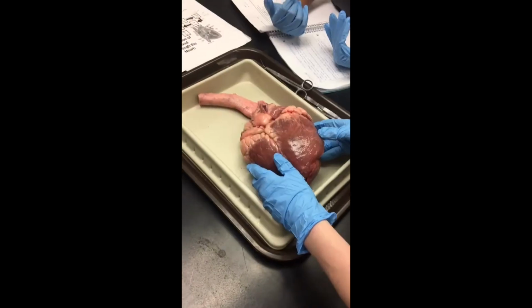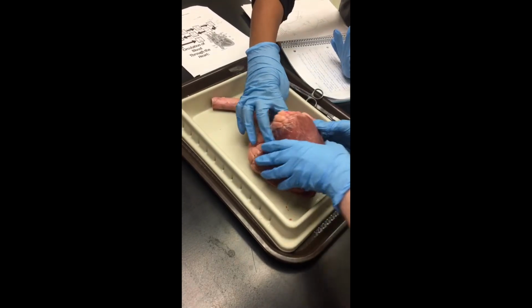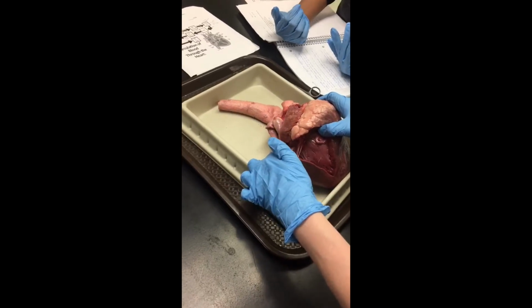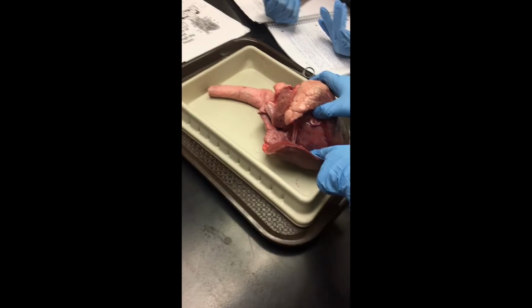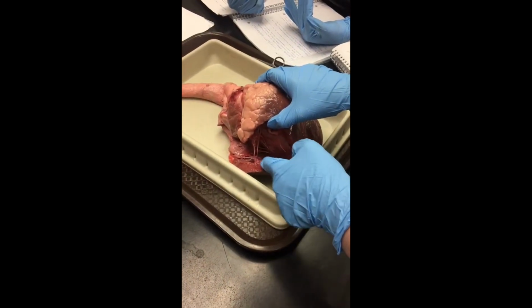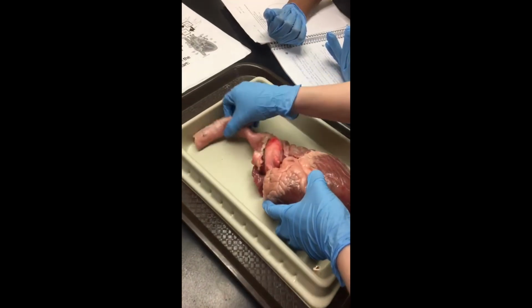Go right. Blood enters through the superior and inferior vena cava into the right atrium. As the right atrium contracts, blood flows through the tricuspid valve into the right ventricle. When this ventricle is full, the tricuspid valve shuts to prevent blood from flowing backwards.